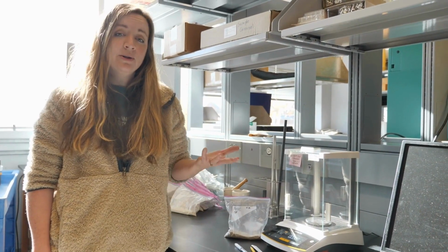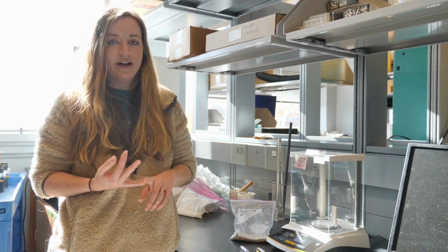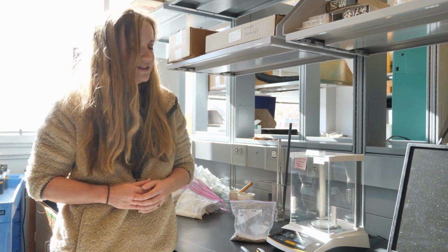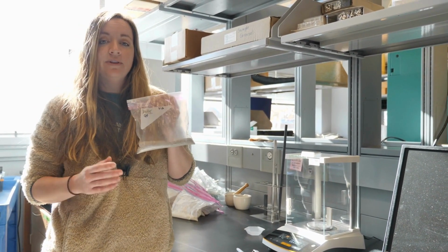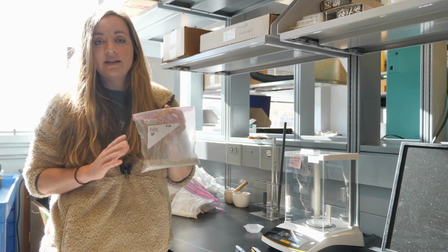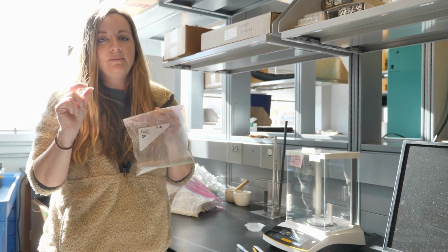So whereas soil bulk density and soil percent moisture can be figured with really basic stuff like volume and wet and dry weight of the soil, to get percent organic matter based on loss on ignition, there are a few more steps we have to take. So first, you need to make sure that you have a soil sample that is oven dried, usually at 60 degrees Celsius, and then pulverized. This can be done by hand using a mortar and pestle or by using the Wiley mill. Typically, we grind our samples down to about a 2 millimeter fine grain.